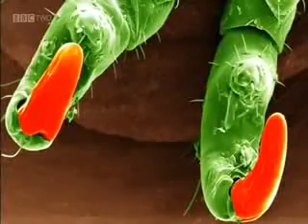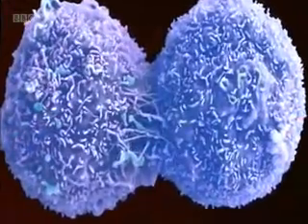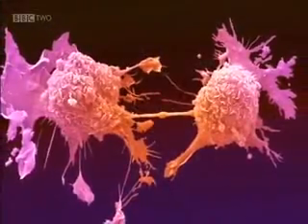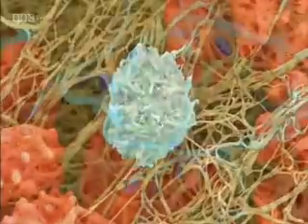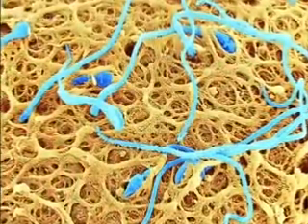A pubic louse on its claws, cancer cells splitting, a blood clot, and human sperm cells on the surface of an egg.